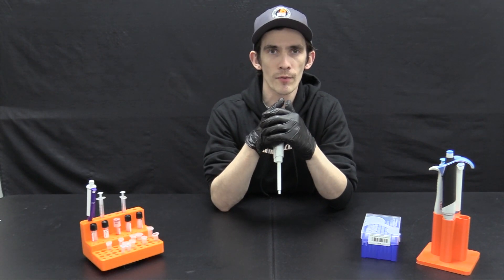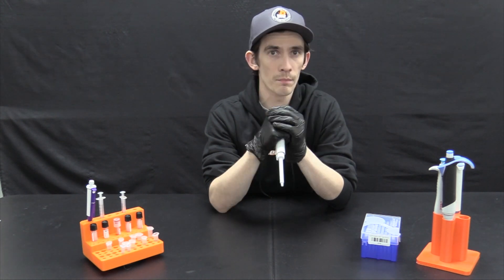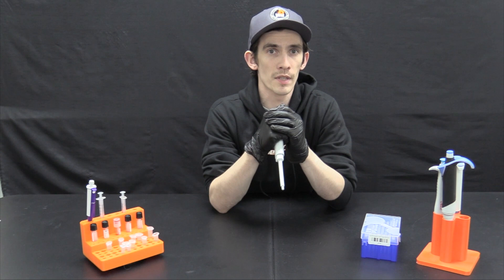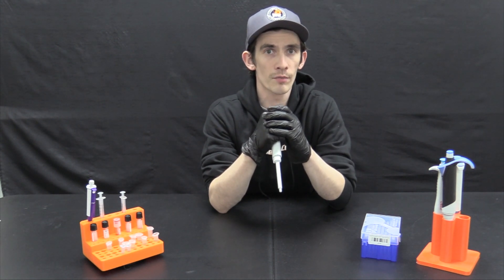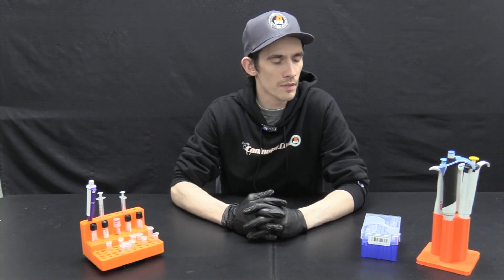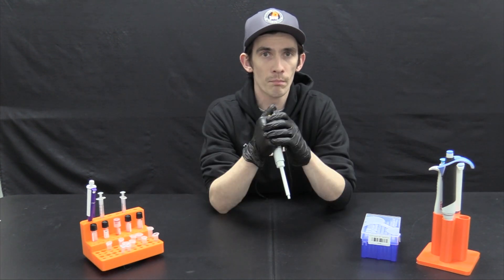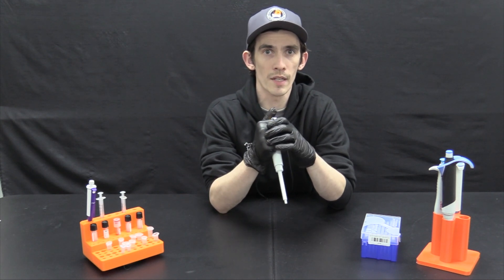Hi and welcome back to the Canine P4 Training Portal. Today we're going to be looking at how to pipette. Pipetting may seem simple, and it is, however it is one of the most commonly missed steps of the entire testing procedure. If it is done incorrectly, your results will also be incorrect. This demonstration will show how to properly use the pipette and some of its features. Master these simple steps and you will be well on your way to accurate and profitable testing.